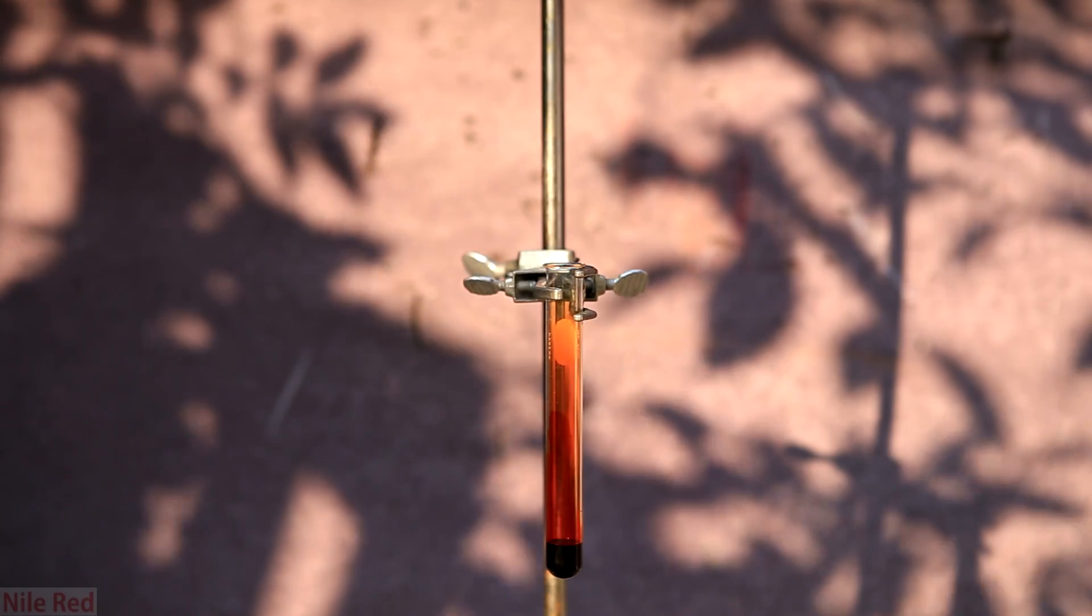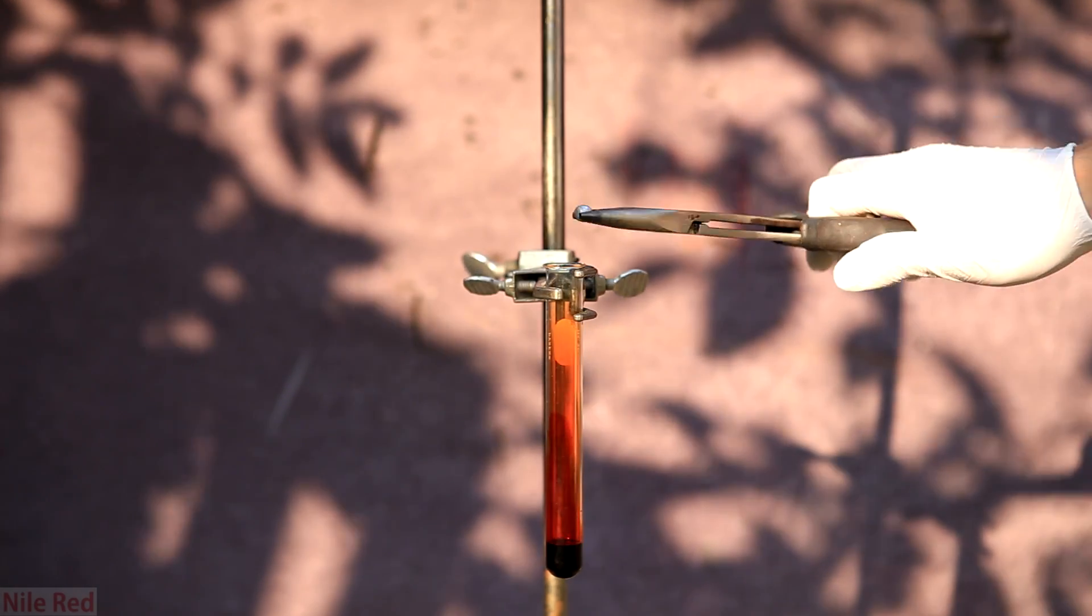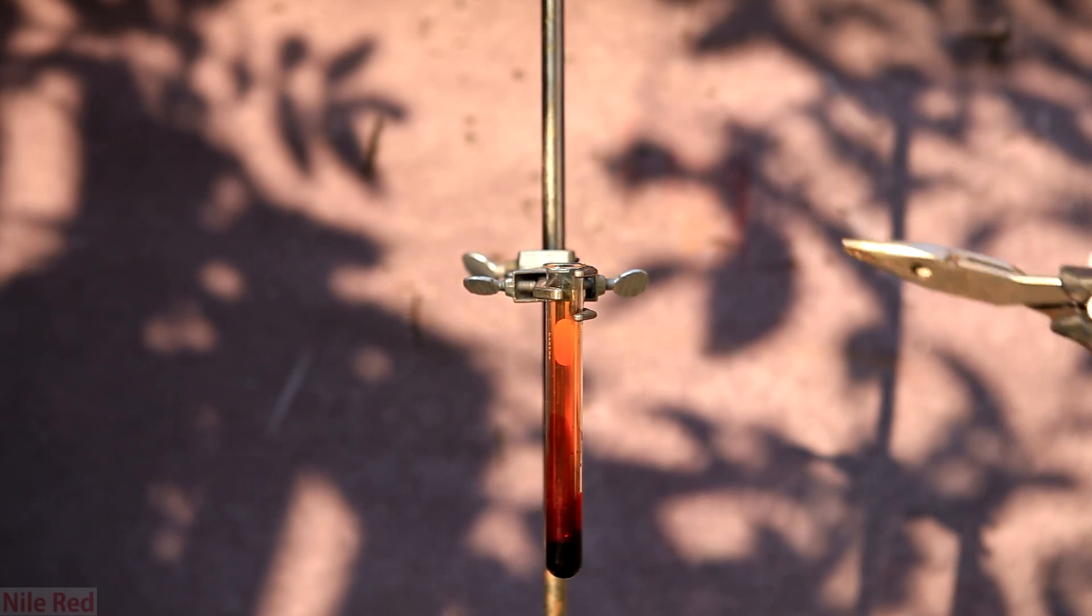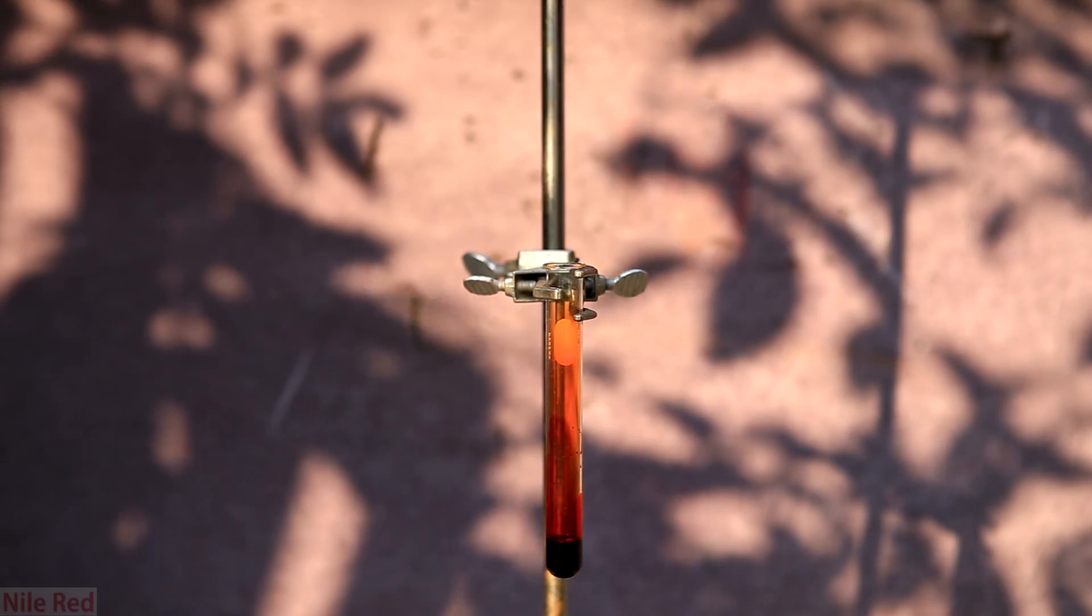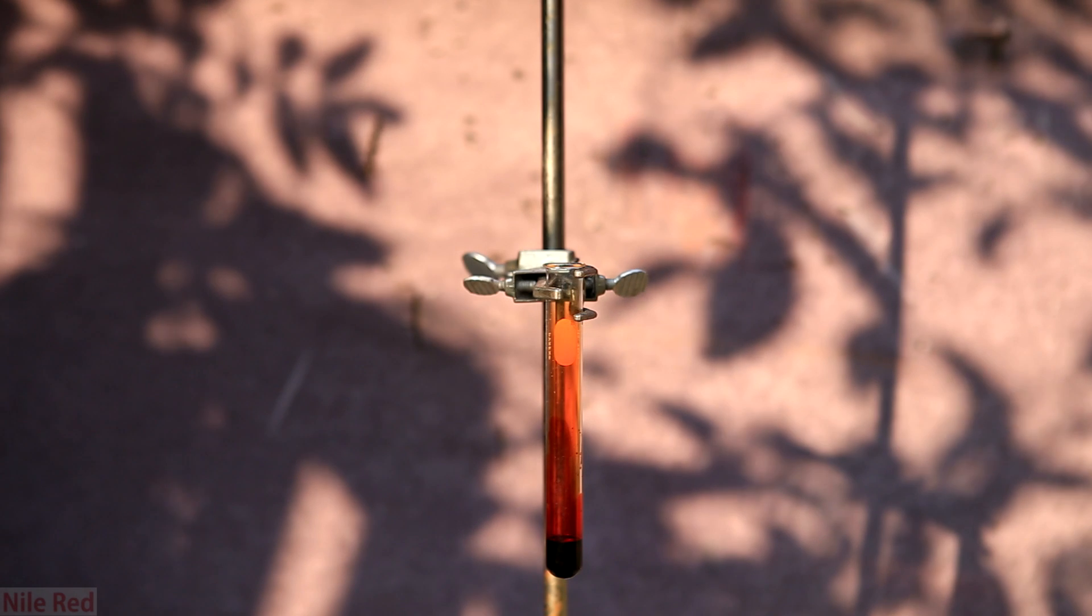For the second run, I opted to use the aluminum ball that I got in the previous one. And in this run, due to the decreased surface area, it took a much longer time to react.